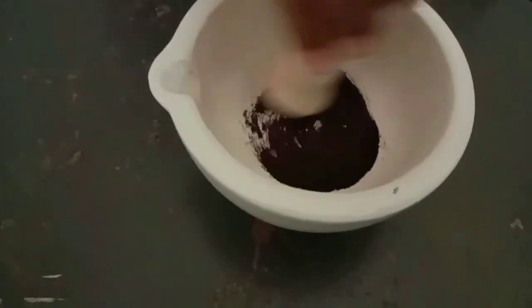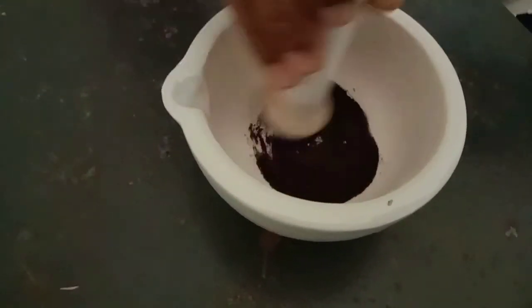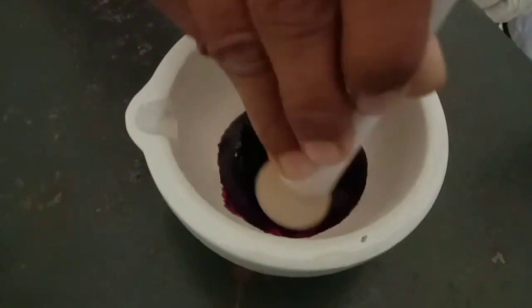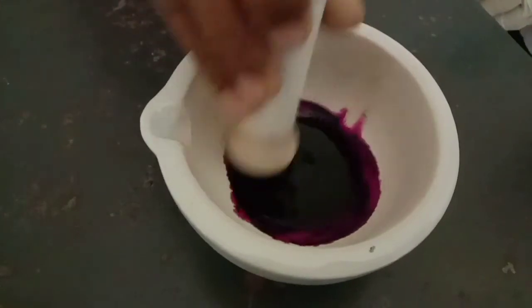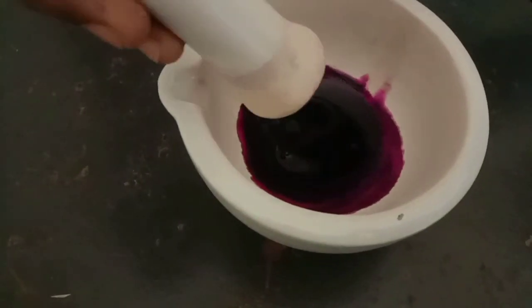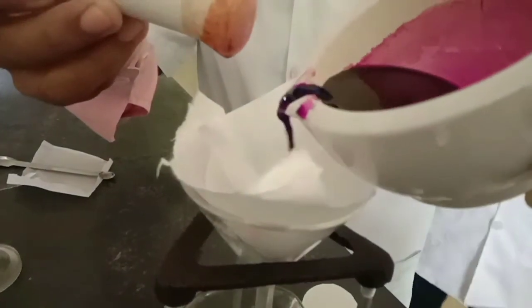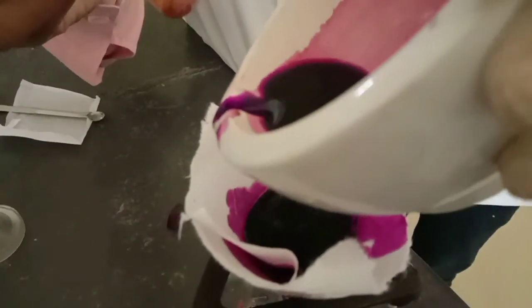Now let's start the procedure. We have taken a mortar and pestle, placed the measured amount of potassium permanganate in it, and are triturating it to reduce it to a fine size. We have added some water to make a smooth paste and are again triturating it. We then add water slowly, and after thorough trituration, we add more water and transfer the supernatant fluid into another beaker using a filter paper and funnel.